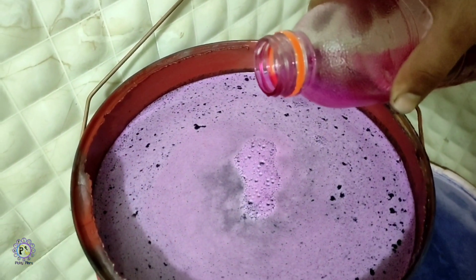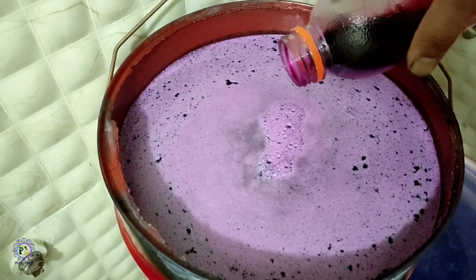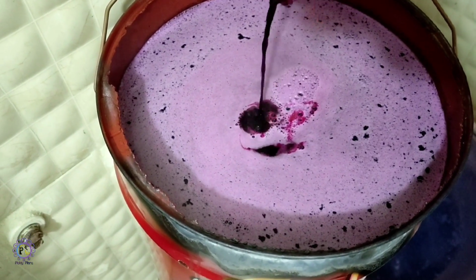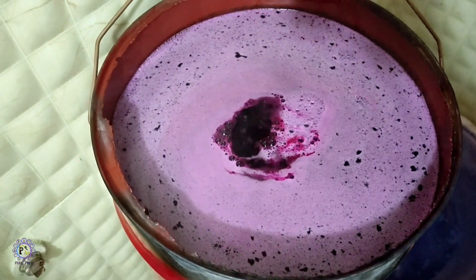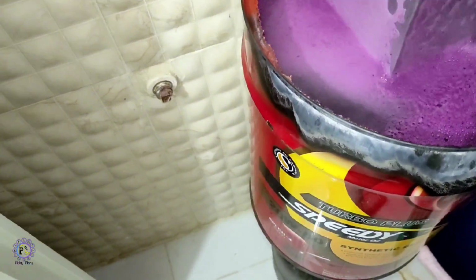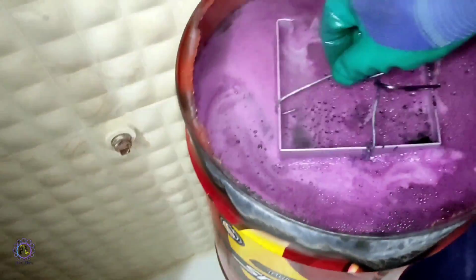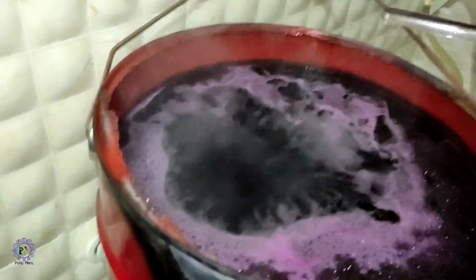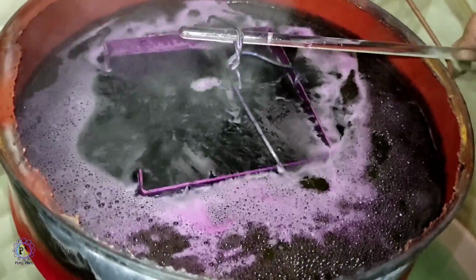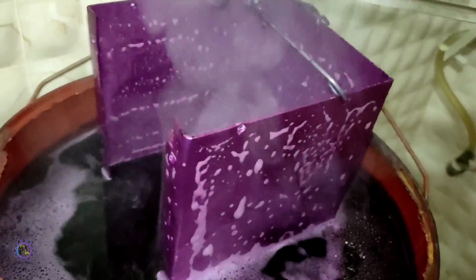In the meantime, a dye bath was prepared by adding some printer ink to the water and being heated on the stove. The anodized part was added to the dye solution to absorb color. And after 15 minutes, this is the finished look of our aluminum casing. Beautiful.